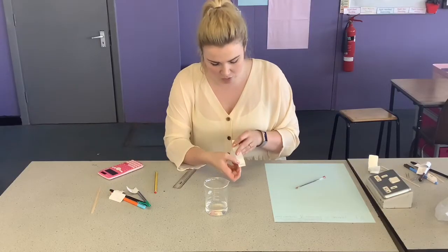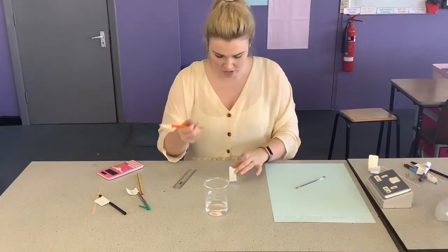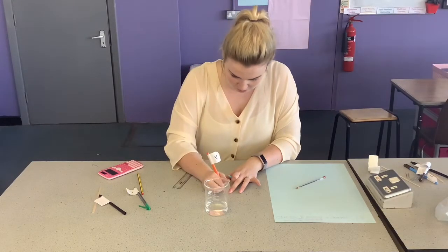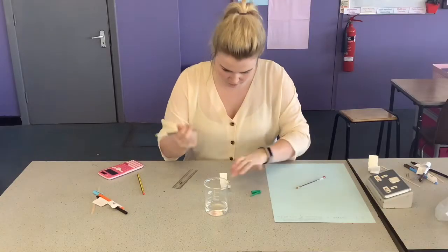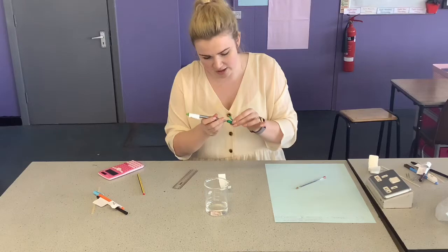This is quite a small piece of chromatography paper, so I'm only going to run two samples. With your samples, you want to do a dot — not a really large dot, about that size. A nice dot so you get a good clear run.